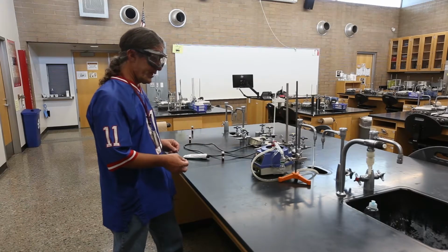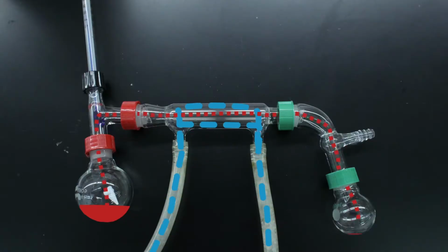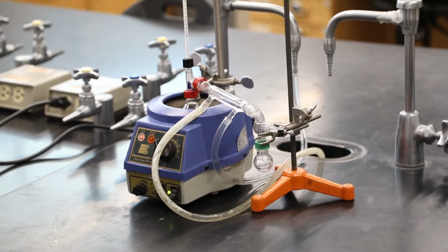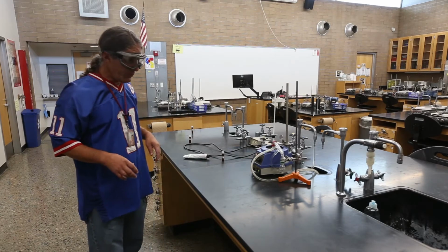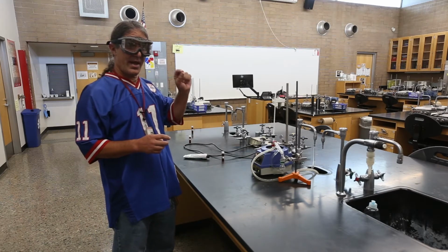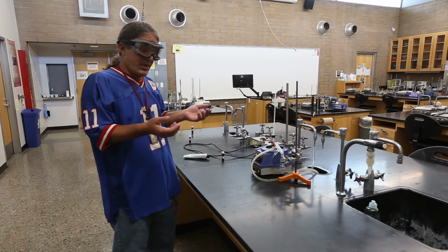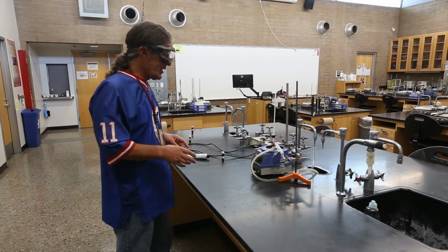The temperature we're really interested in is when we start collecting the liquid. So that's the boiling temperature of the material, and that'll help us to identify it. The other thing that oftentimes we'll teach in the lecture is that phase transitions happen at a constant temperature. You might wonder, well, what does that really mean? Now we'll get to see it in action.